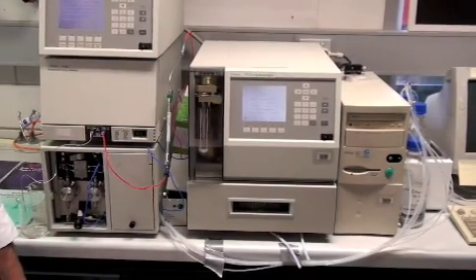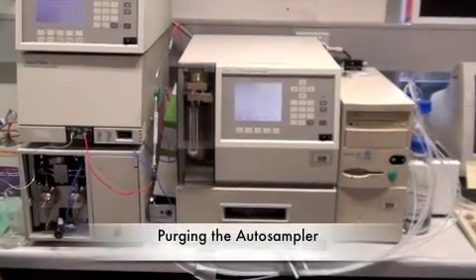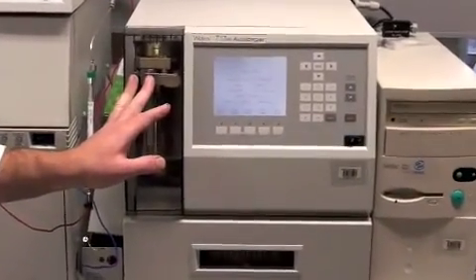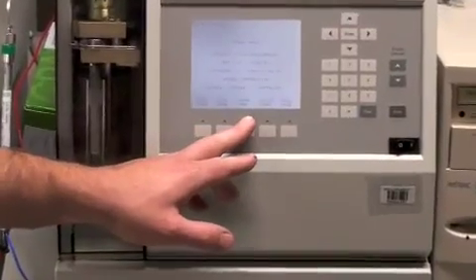Once you've finished switching on all the devices, the first thing that must then occur is the auto sampler must be purged. This is achieved by pressing this button, which is the purge page button.